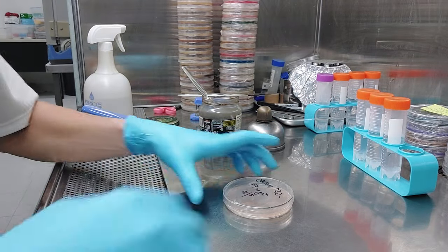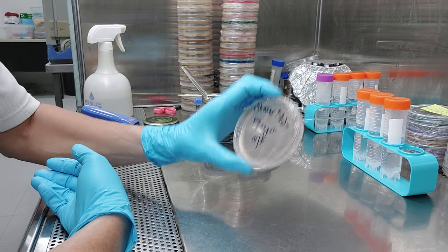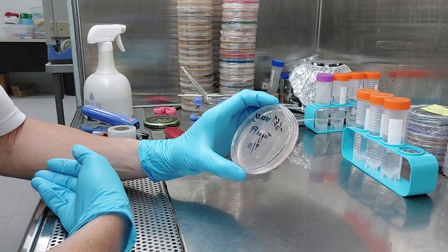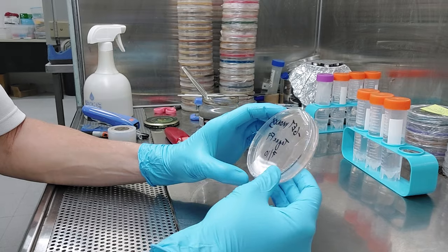Hello everybody, I wanted to remake one of my grab-and-drag videos. I'm trying to pull toque monos here, and I have a lot of people ask me about this, how I do it, lots of different questions anyway.